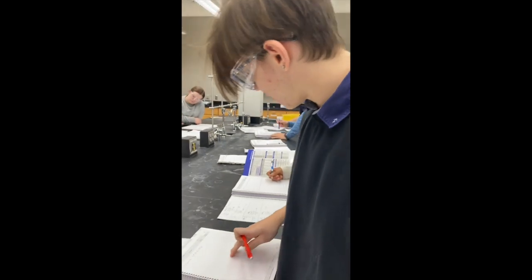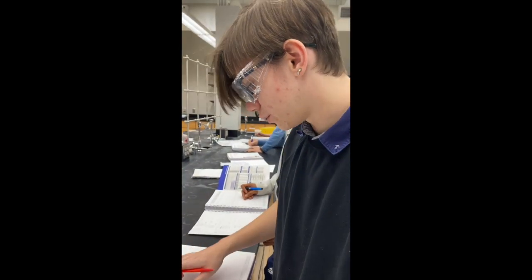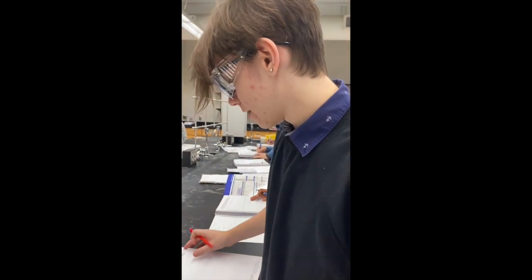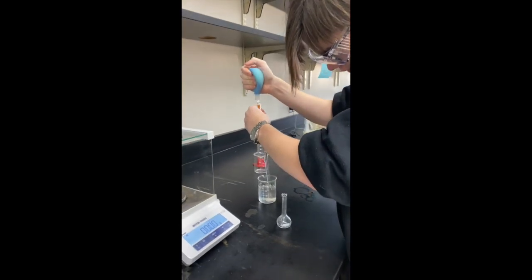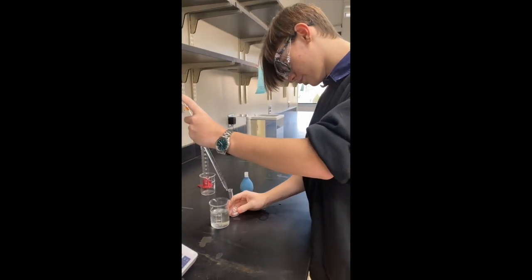Here we are finding what percent of our dilutions are, like how diluted our four different dilutions are, by using the M1V1 equals M2V2 formula. That way we can compare the densities and the dilution percent. The density of our unknown. We already know how many milliliters we're going to put into it. We're just going to fill the flask, so it'll be 25 milliliters of the unknown.